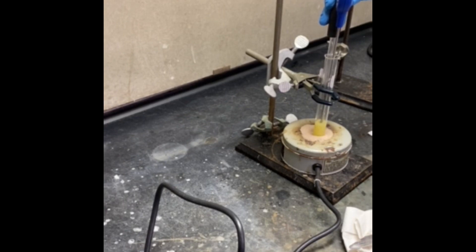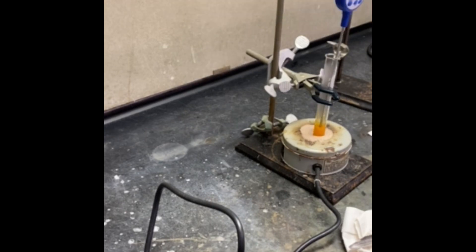As you can see, the color of the solution is changing. The temperature right now is 157°C and it's increasing slightly, and then it's going to jump up soon. You can see that beautiful color keep changing.